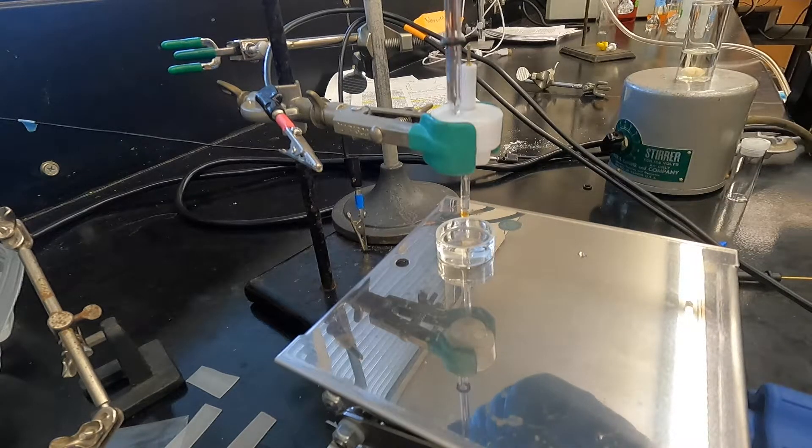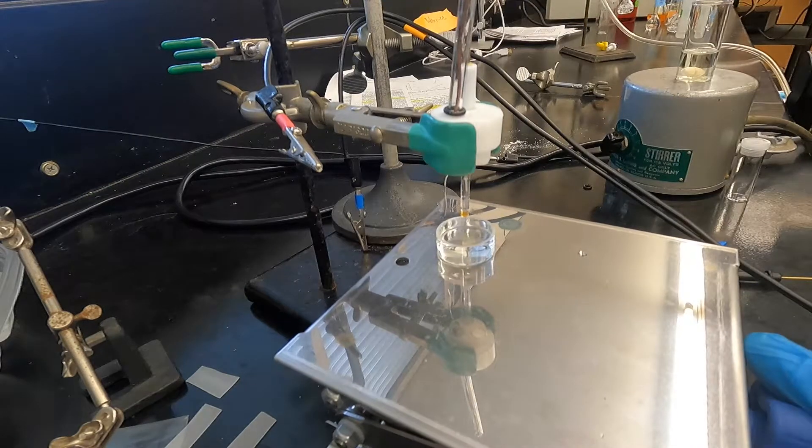You can also use a graphite rod, but just since we have these more accessible, this is what we're using today.